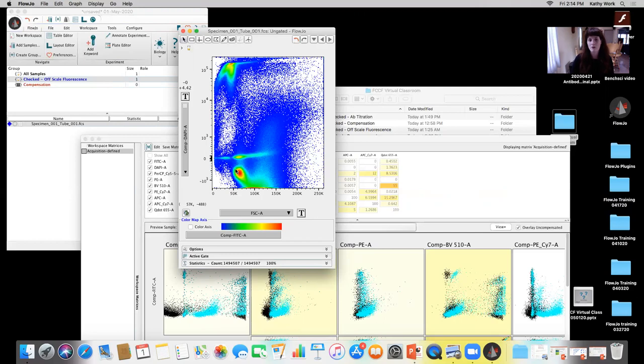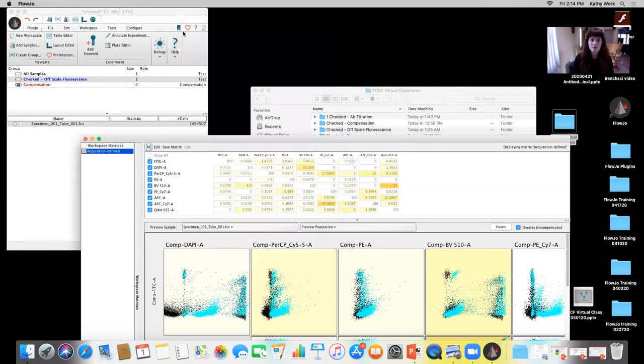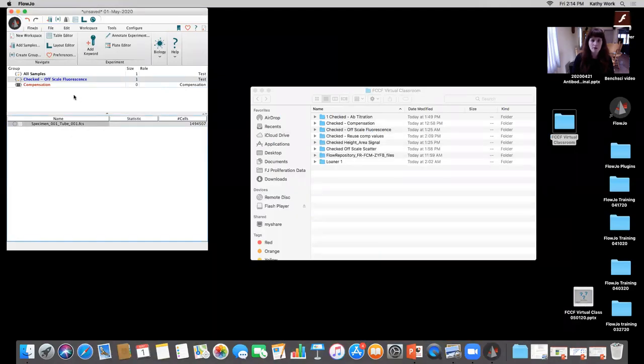So this is just a nice example to show why you want to make sure at the very beginning of your run, you check all of your controls, but you also check your fully stained sample that you expect to be the brightest for all parameters to make sure it's on scale. That would be my suggestion for this user. Throw on that fully stained sample, make sure everything is on scale. And if it's not, make sure it is, and then make sure your single color controls are as bright or brighter so that you can have the correct compensation. So not much crazy analysis there, but I just wanted to show you that. Okay.